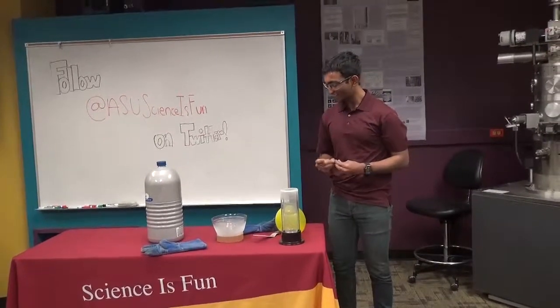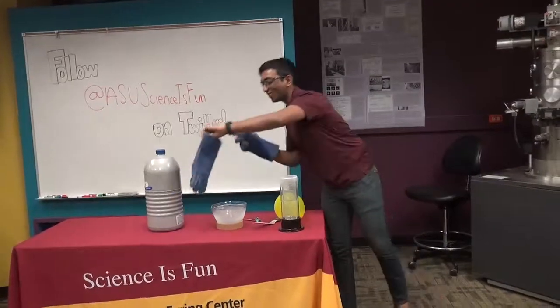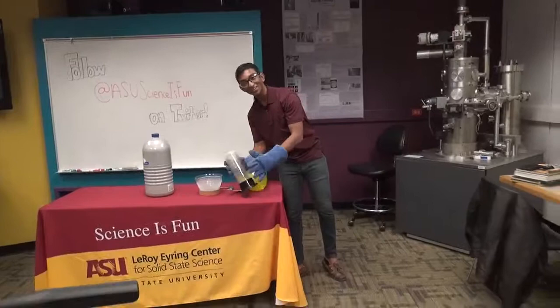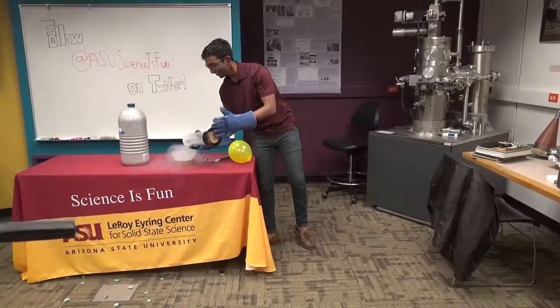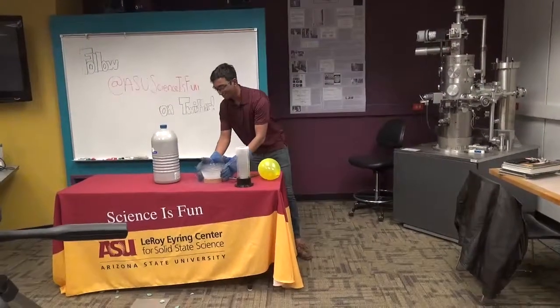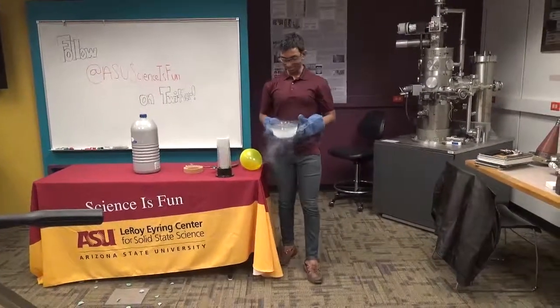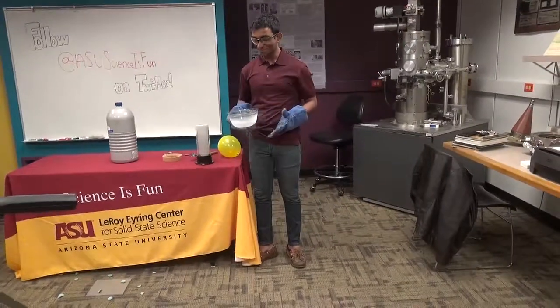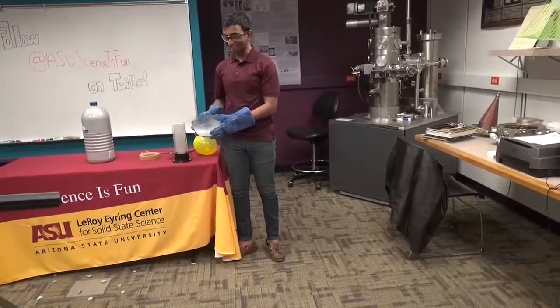All right, and there's one final thing I want to show you about liquid nitrogen. It's our grand finale, if you will. Now for this grand finale, we need some way to get rid of this liquid nitrogen. We can't take it back with us, right? So I want all of you to be very careful, but look at this real quick.